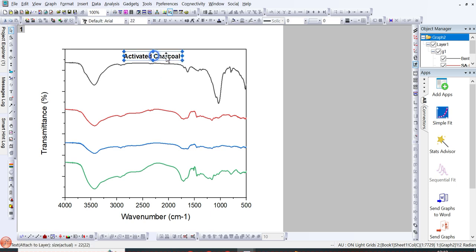In the same way, you can copy paste and label the second spectral line. For example, if this is the biochar line, then you can write it as KOH modified biochar. So you can also increase or decrease its size. In the same way, you can label these spectral lines as well.